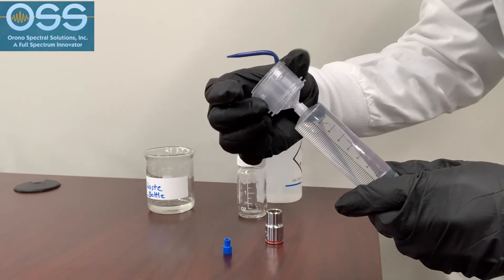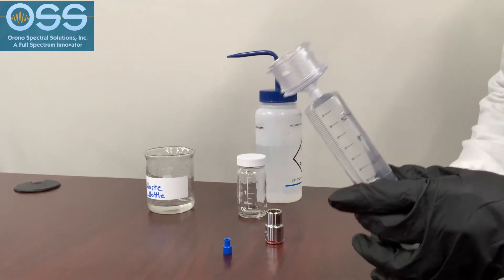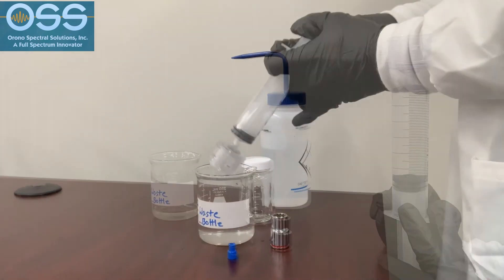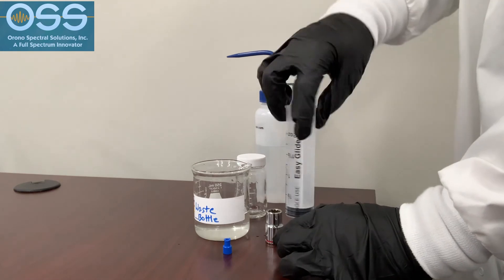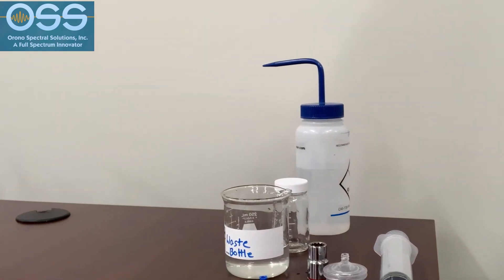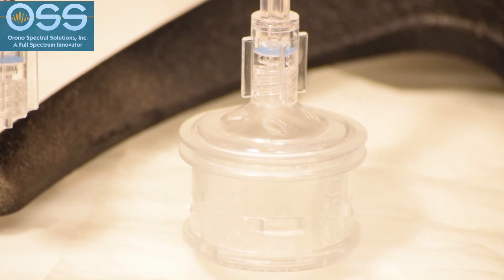A 25 mm clear shot extractor is attached and all of the liquid is pushed through into the extractor. The extractor is then dried using the OSS drying manifold equipment.